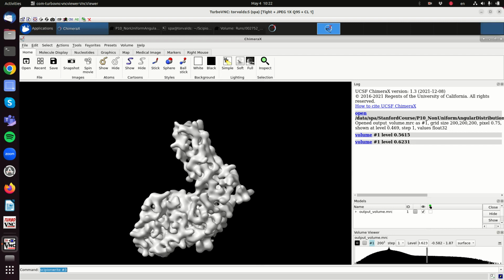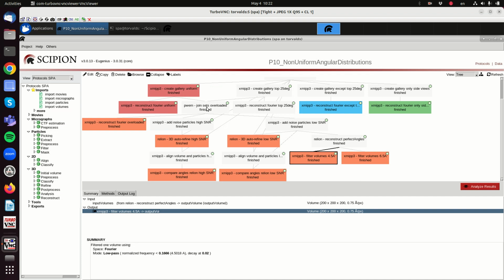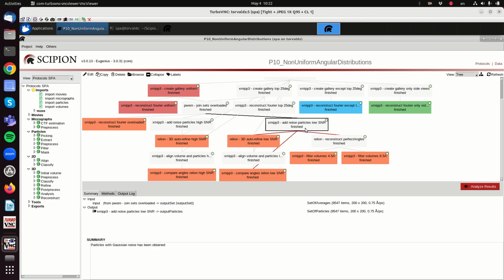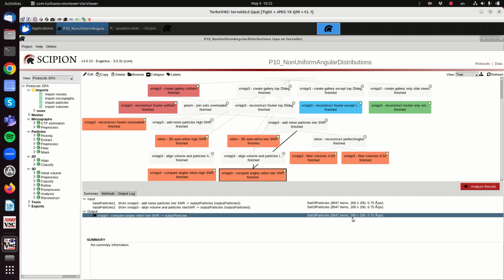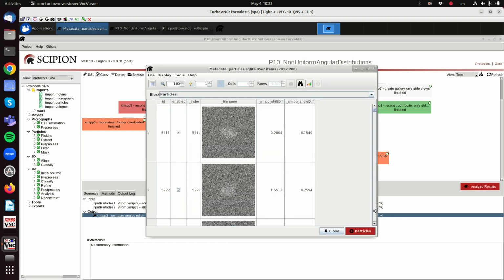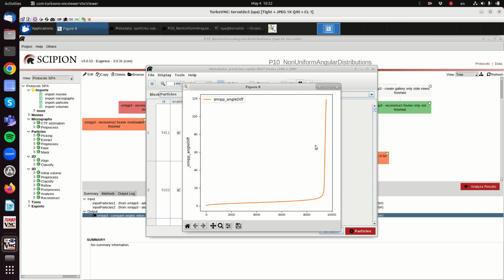The problem comes when you have overloaded directions, you have low signal to noise ratio, and you have to estimate your angles. Still we can check for how many angles we did it right. We'll see the result of the map now. For how many angles we did it more or less right, it seems that we did it more or less right for many of them, and the error is not that high.